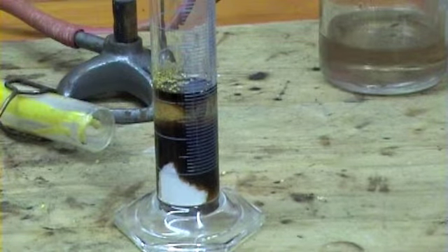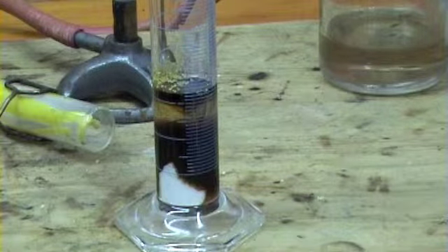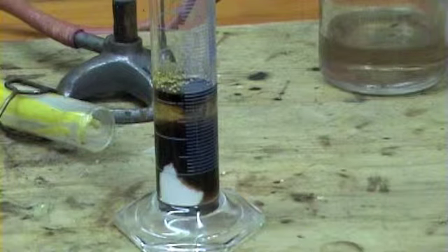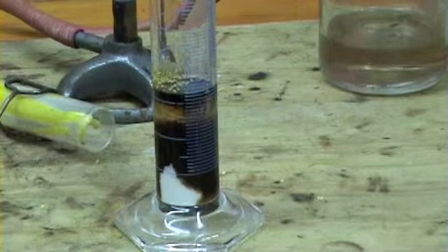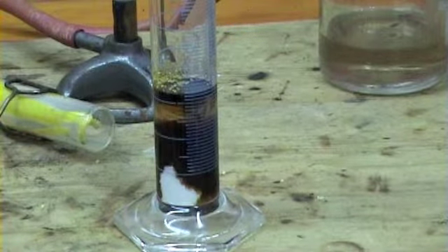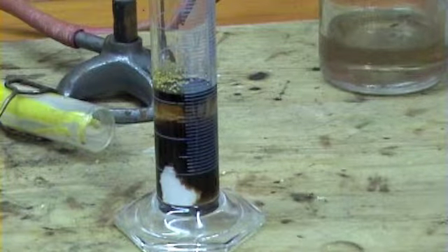This is, of course, pretty similar to how it would deal with your skin tissue. If you get concentrated sulfuric acid spilled on you, it normally doesn't cause much of a problem until you actually add water, and then it's really a problem. It really burns badly. You really need to sprinkle on baking soda or something like that.